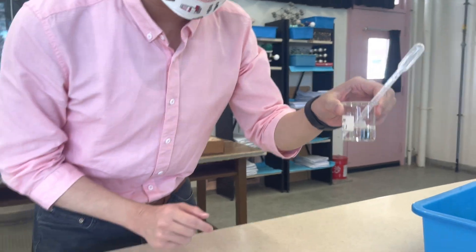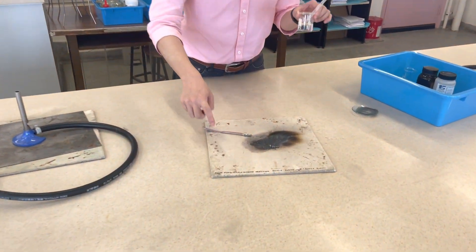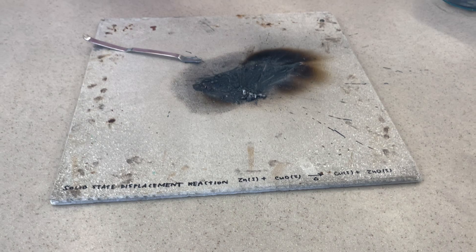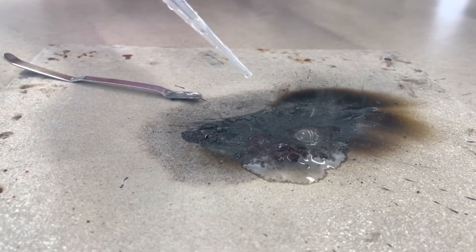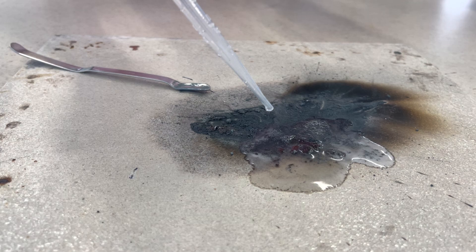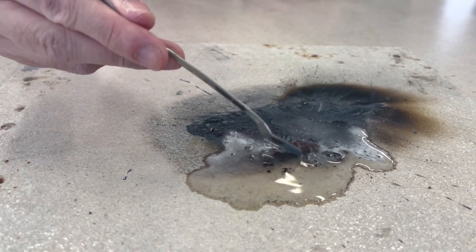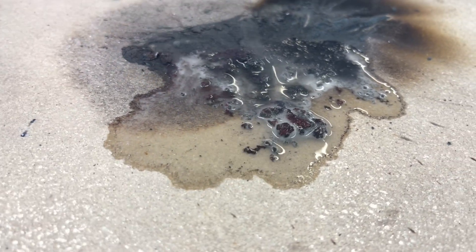I have 2M HCl — hydrochloric acid — which can dissolve those oxides. In this solid-state displacement reaction, after heating the zinc and copper(II) oxide, a displacement redox reaction occurs and we obtain copper metal as well as zinc oxide. When we add the hydrochloric acid onto this mixture, you can see the zinc oxide — the white powder — will actually be dissolved, and you can see the copper metal remaining. The reddish-brown solid that is obtained is obviously the copper metal.